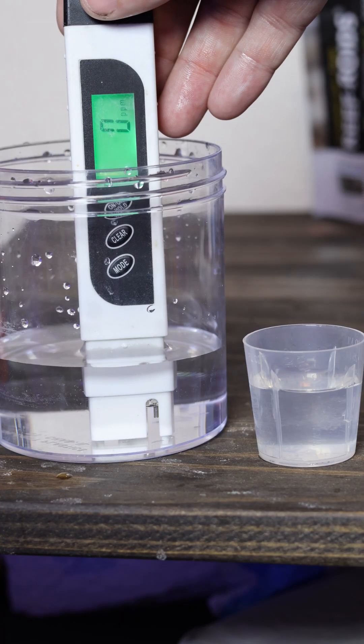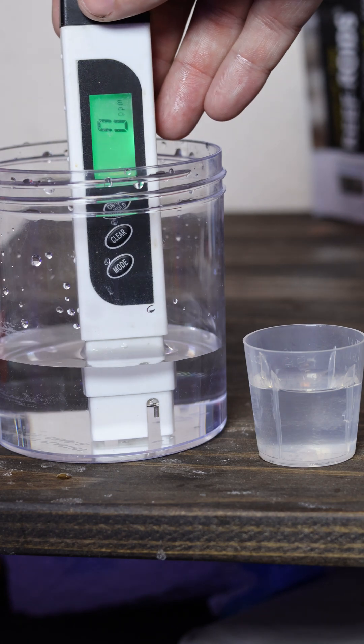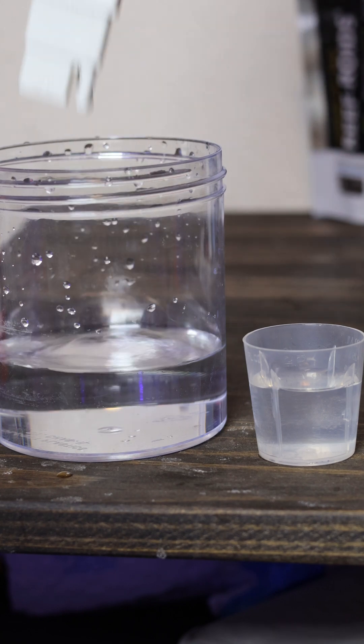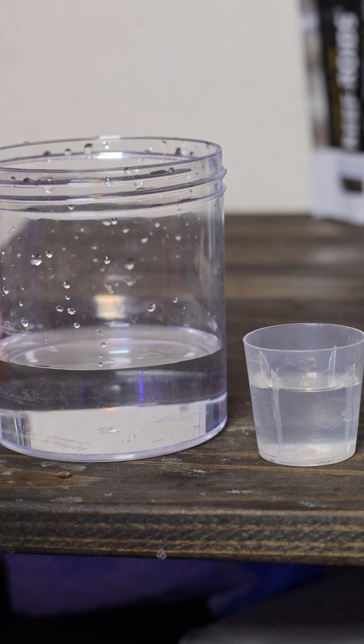To start off we're going to need two sample cups. One of those sample cups needs to be RODI water - not distilled water, not tap water, not salt water. It needs to be 100% RODI water. And then we're going to need a small sample of salt water.